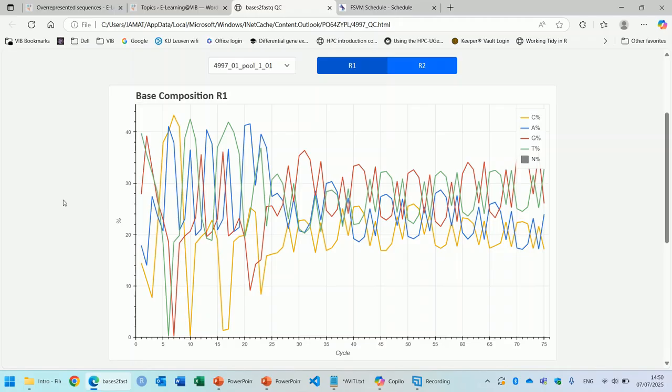For every position, you see the percentage of each of these bases. You don't expect that the percentages of these 4 bases are equal for every position, because this depends on the GC content and the genome of the organism that you work with. But in a diverse and random library, you do expect that the chance of seeing a C is equal in every position in the read. So in other words, what you expect here are flat lines.